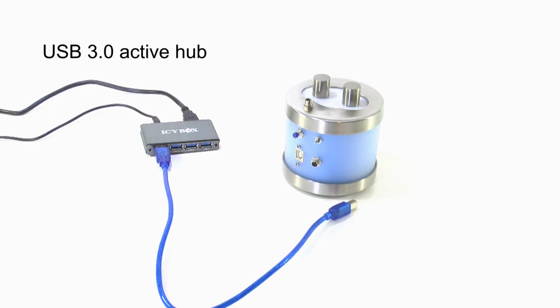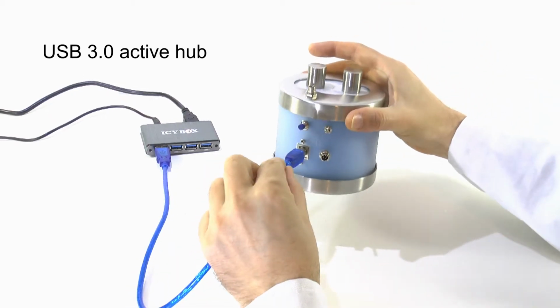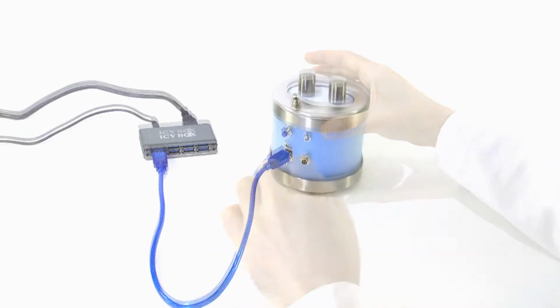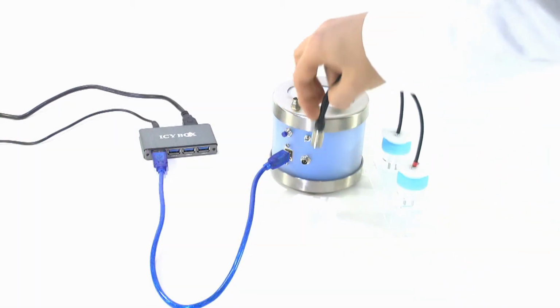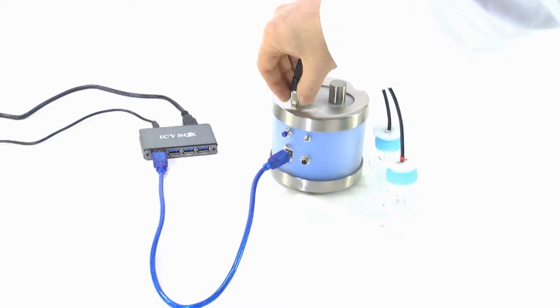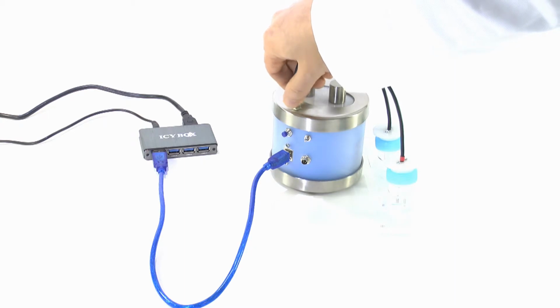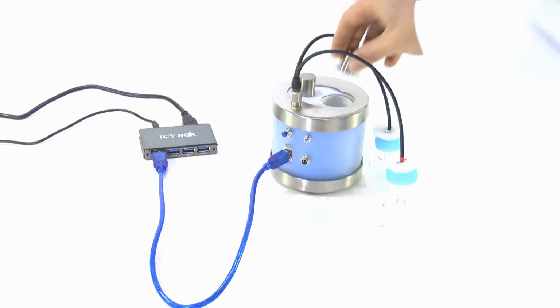Connect the spectrometer to a USB active hub. Use a short USB cable. Connect the water containers and electrodes with the spectrometer. First, fully insert the connector and then screw the metal fixator. Insert the water containers into the thermostat.